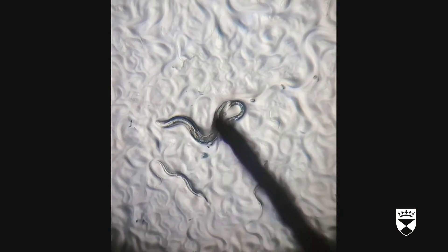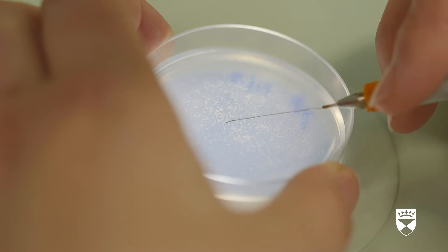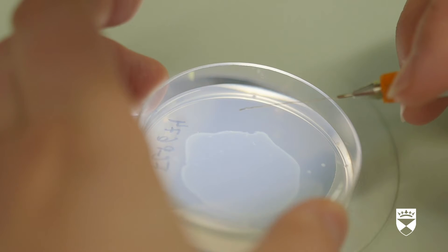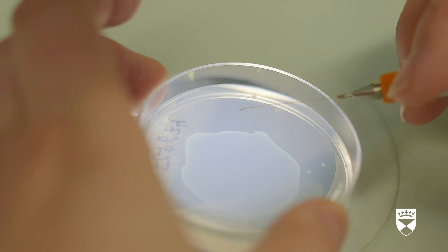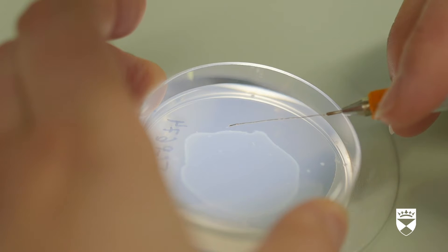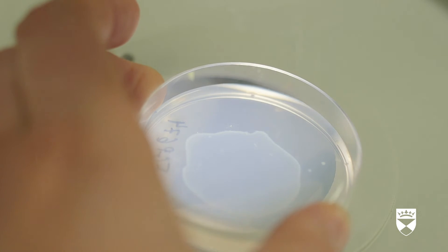We use these worms because they are simple organisms that have the same parts we want to study that more complex organisms, such as humans, have. A scientist uses a tool to scoop up a worm from one agar plate and place it onto a second agar plate. They are easy to look after and reproduce quickly — their life cycle is approximately three days.